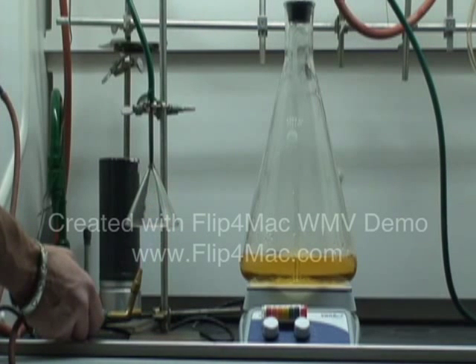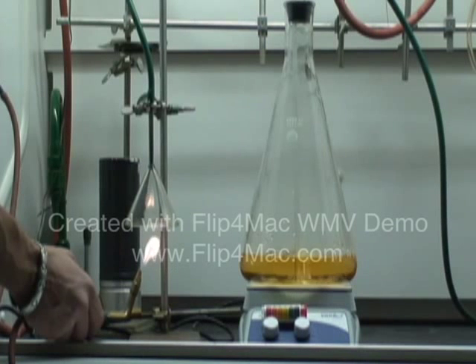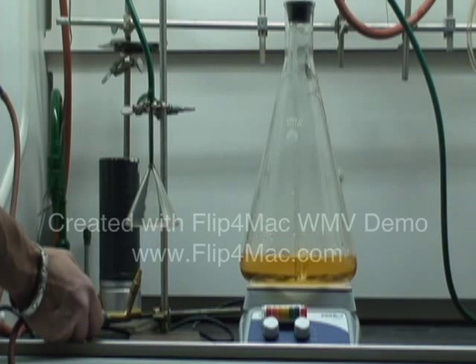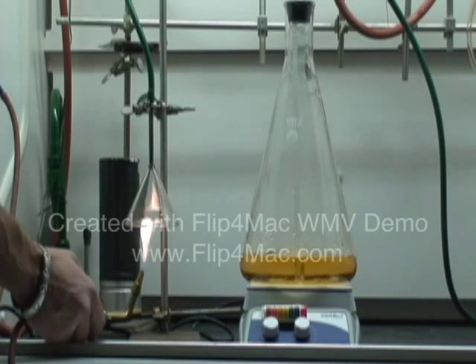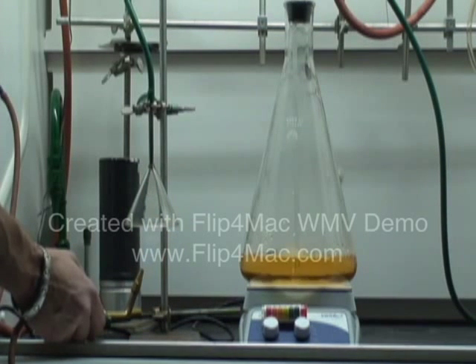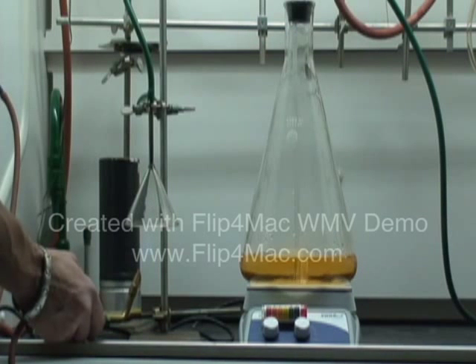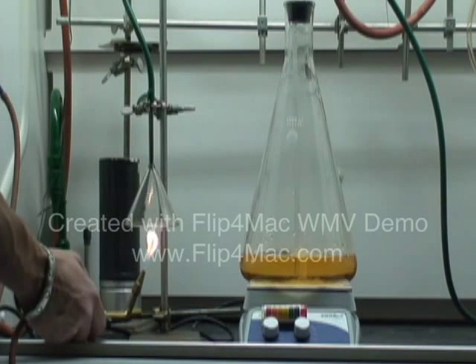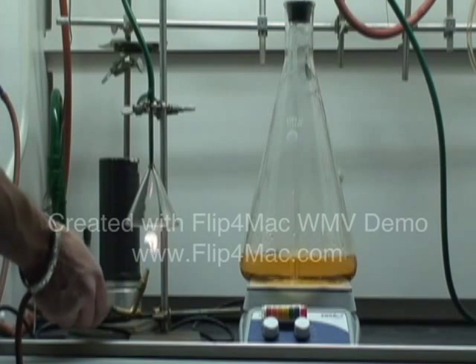As you can see, the pH of the solution containing the combustion products of natural gas dissolved in water has lowered the pH, somewhere perhaps around a pH of five, maybe a little bit higher.